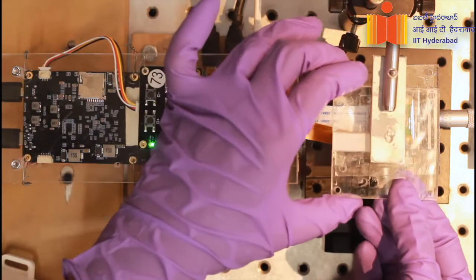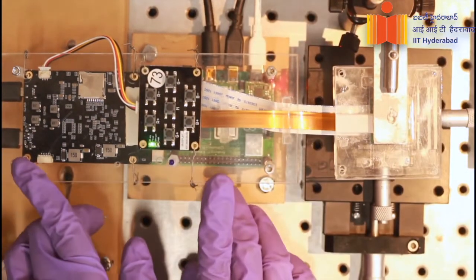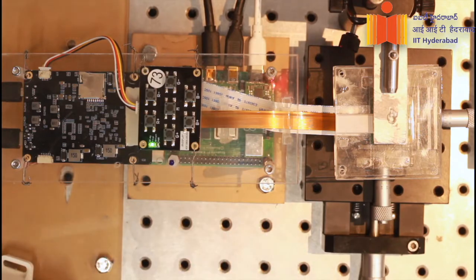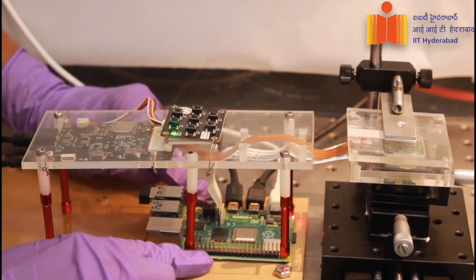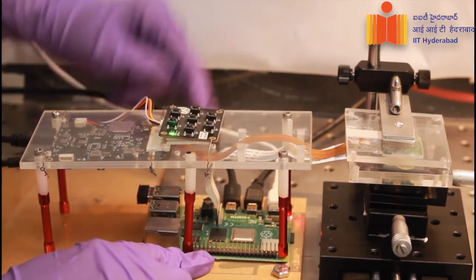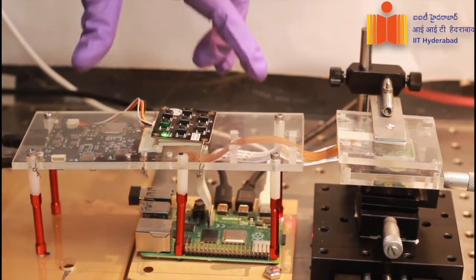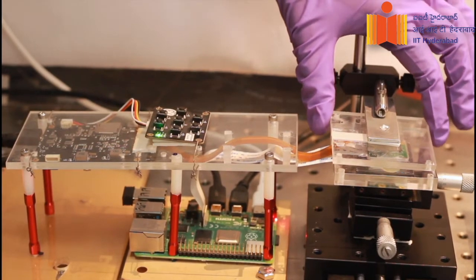This is how we assemble MuScope. This is the driver board which interfaces the micro LED display with the single board computer. The micro LED board is connected to the single board computer using a micro HDMI cable. This board treats the micro LED display chip as an extended display. The micro LED control board is used to control the brightness and actuation of the micro LED chips.